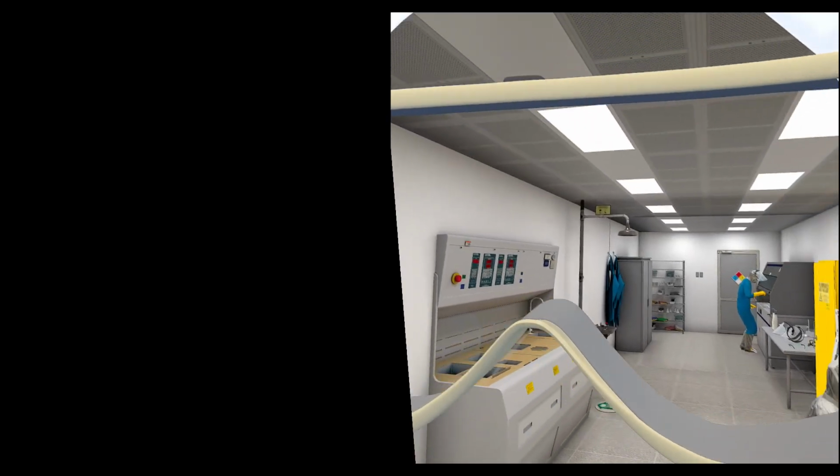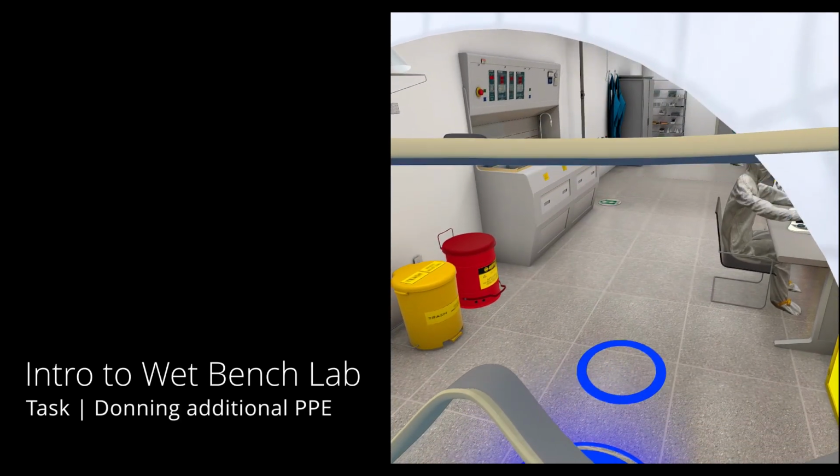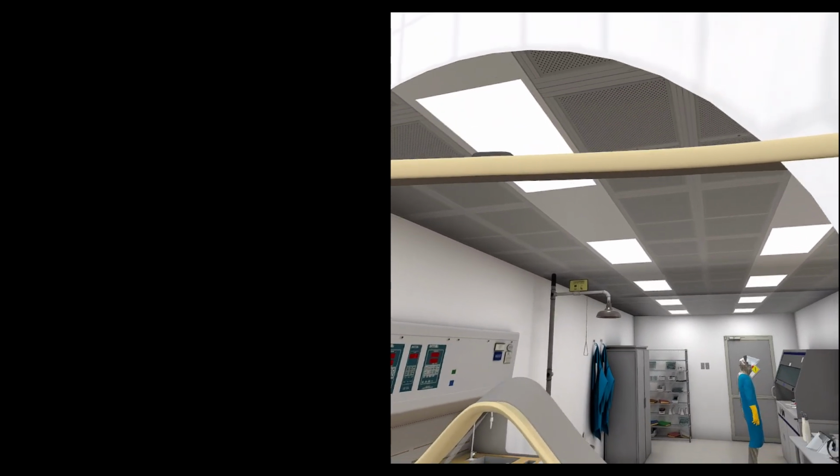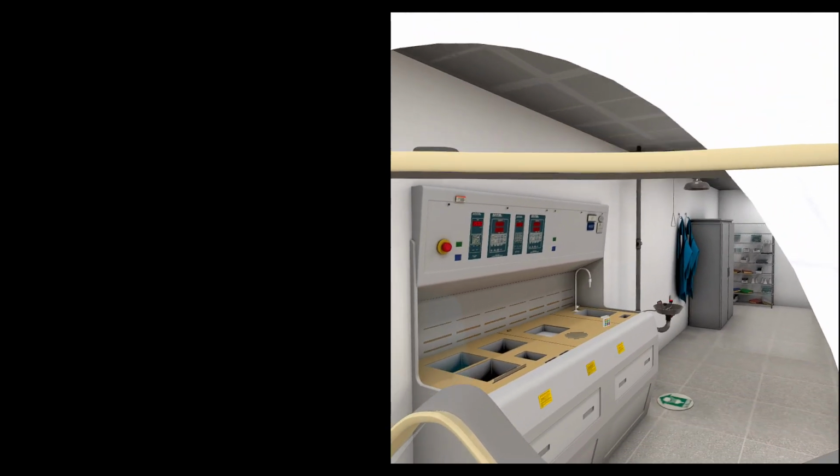Welcome to the lab. Before you can work at the wet bench or clean up the spill, you will need to don more PPE to protect you at the wet bench. Proceed with donning your PPE.